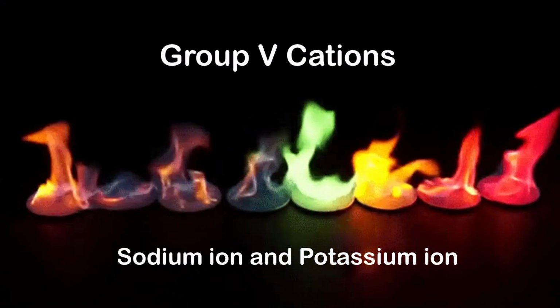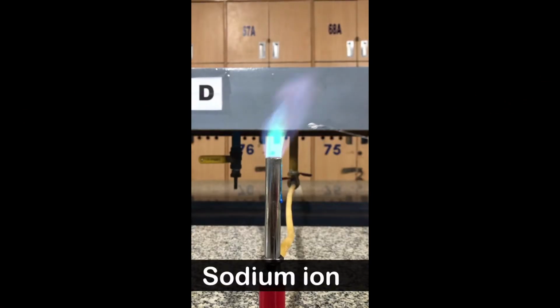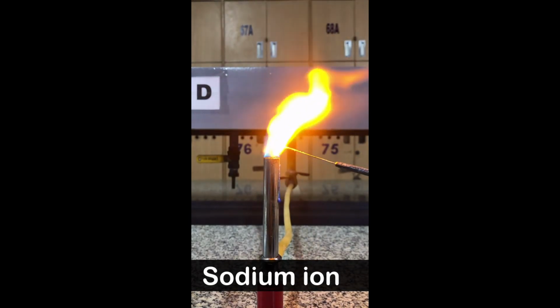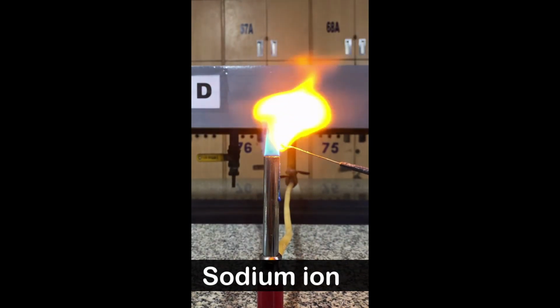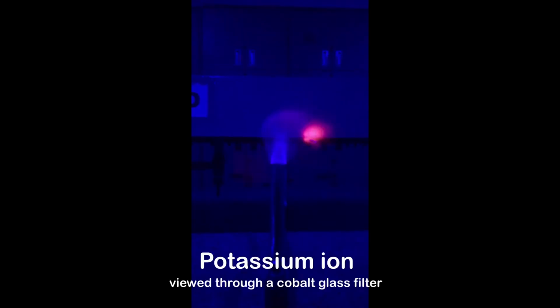Lastly, I'll show you the results for the flame test of the group 5 cations, specifically your sodium ion and potassium ion. For the first one, we have the sodium ion. Lastly, we have the result for the potassium ion.